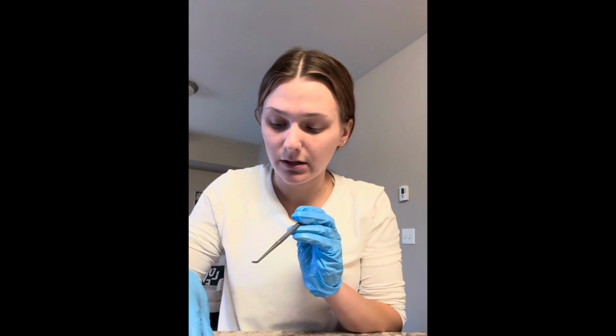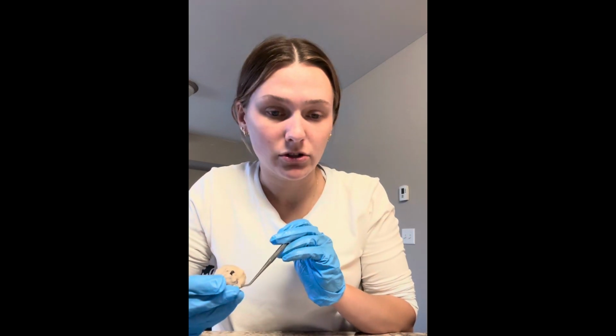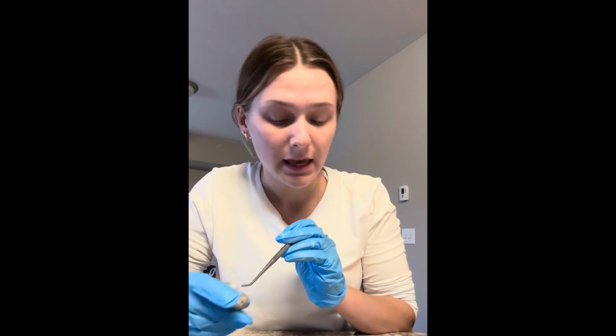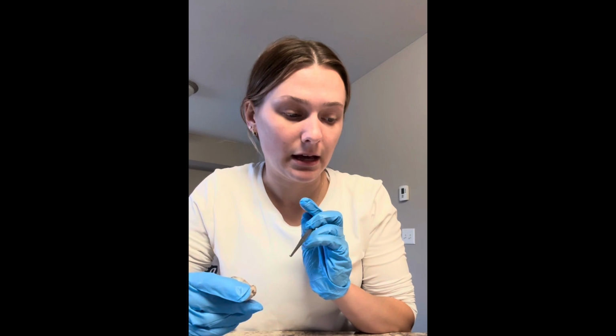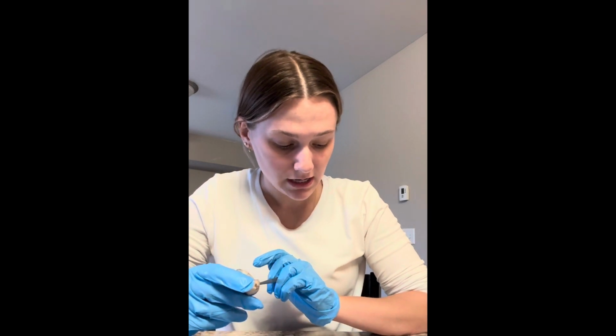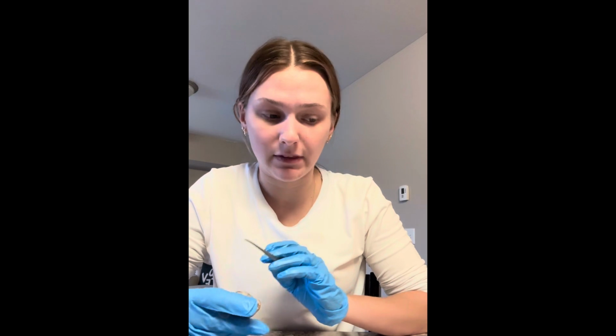All right, so next I'm gonna move on to the back of the eye. So as I talked about the outer structures already back here, I'm gonna move to the inner structures. So in between the back of the eye and the front of the eye in this example, is going to be the vitreous humor, which is viscous fluid that fills the vitreous body and helps maintain the shape of the eyeball.